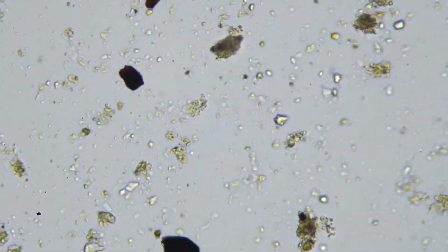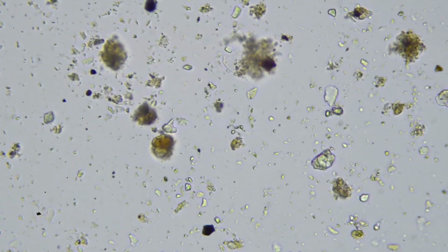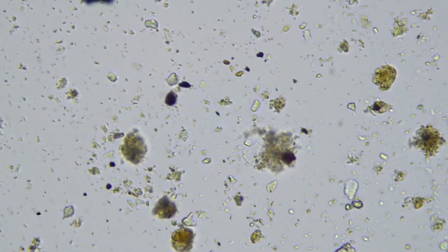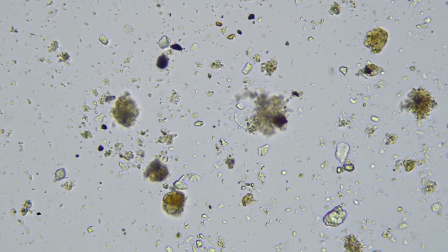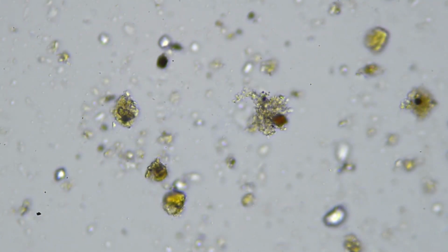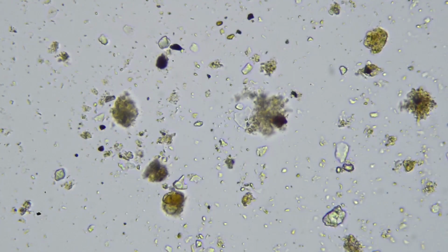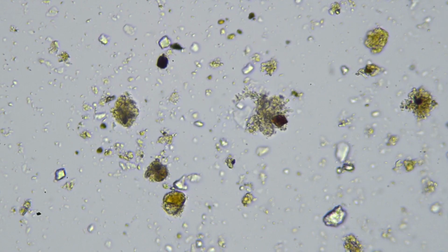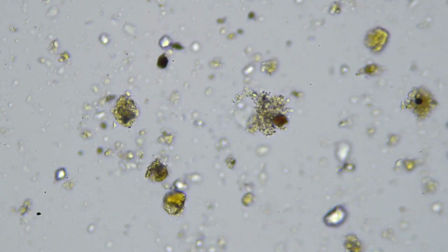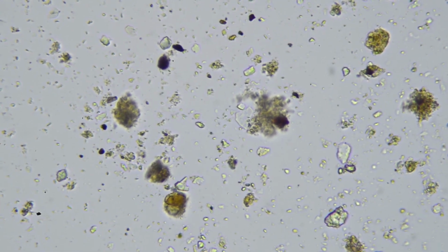Some of these more coloured objects, like, let's find a big one here. These are your aggregates here. So the things that are kind of honey coloured and they almost look a bit like saliva, like that one right in the centre, that's probably going to be largely composed of ulmic acids, fulvic acids for the slightly lighter honey coloured aggregates there. The really, really dark spots will be humic acids, but it doesn't look like there's a huge amount of humic acid present here.